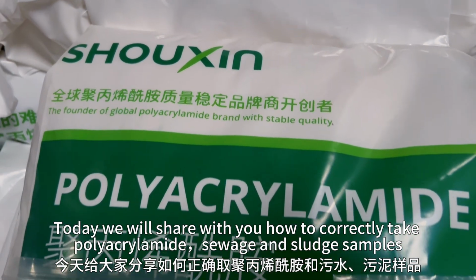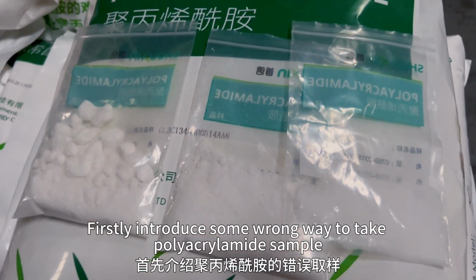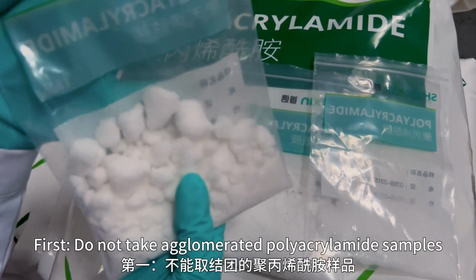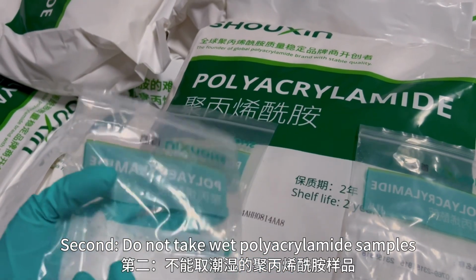Today we will share with you how to correctly take polyacrylamide, sewage and sludge samples. Firstly, let me introduce some wrong ways to take polyacrylamide samples. First, do not take agglomerated polyacrylamide samples. Second, do not take wet polyacrylamide samples.